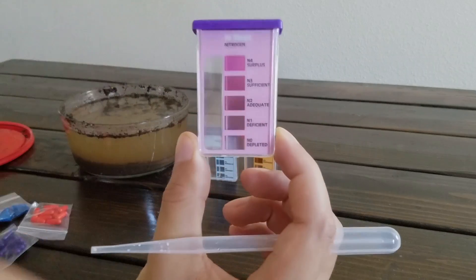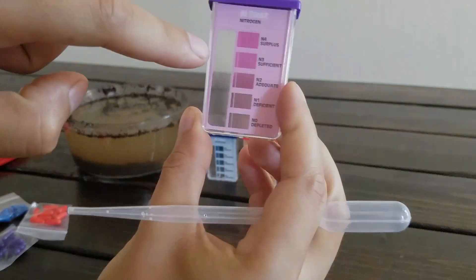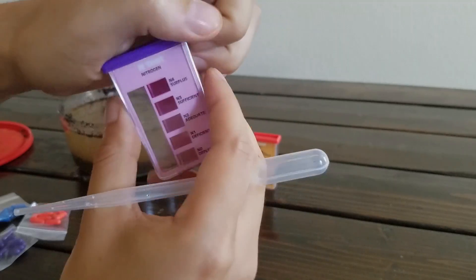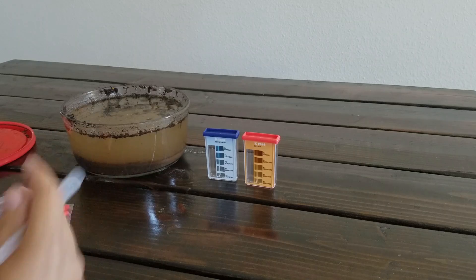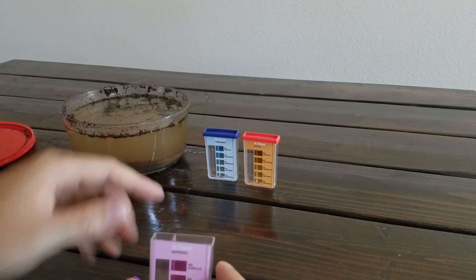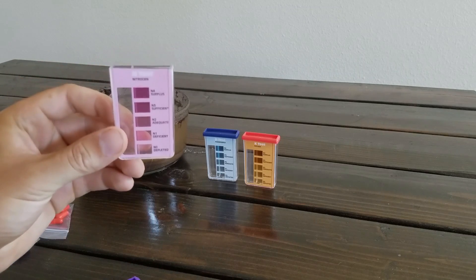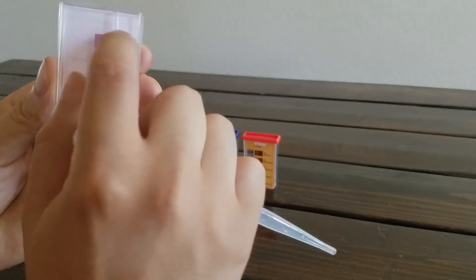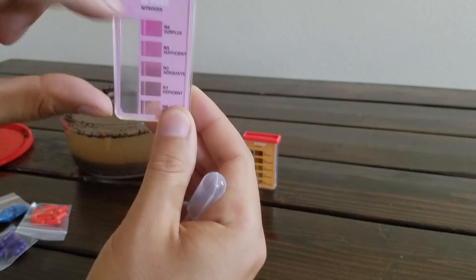What we're doing now is uncovering this and filling up both sides. You have the reference chamber and then the actual testing chamber. The reason you fill up both sides is because this solution is a little bit cloudy — we don't want the discoloration to color our perception of the actual test. I'm going to fill up all three of these to the fill line, which is right about there, because we definitely want it above the highest reference mark.